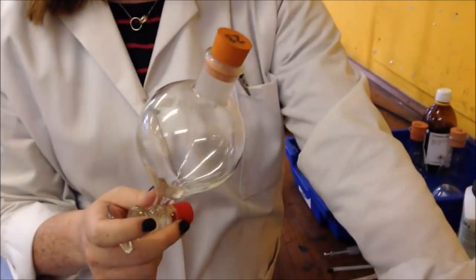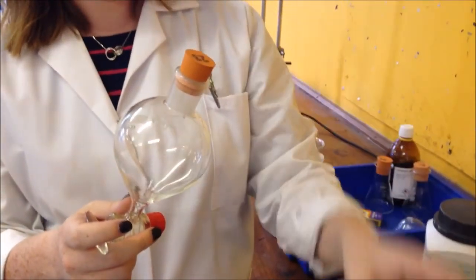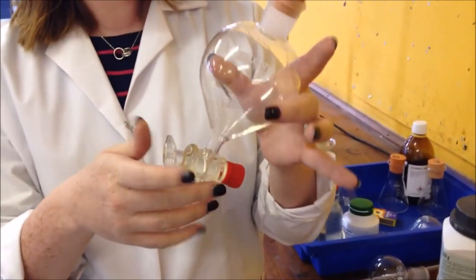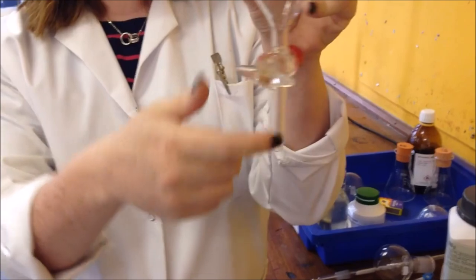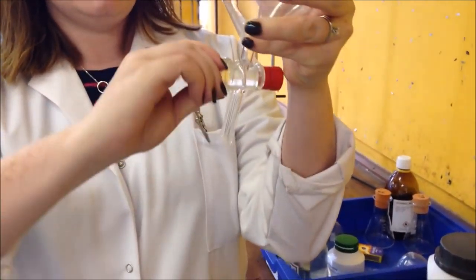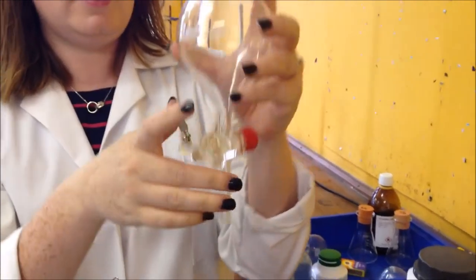So now we've distilled off two-thirds of our solution, we need to add some sodium carbonate to it and put it in a separating funnel. You need to make sure that it's closed when it is in line it's open, when it's not in line it's closed.